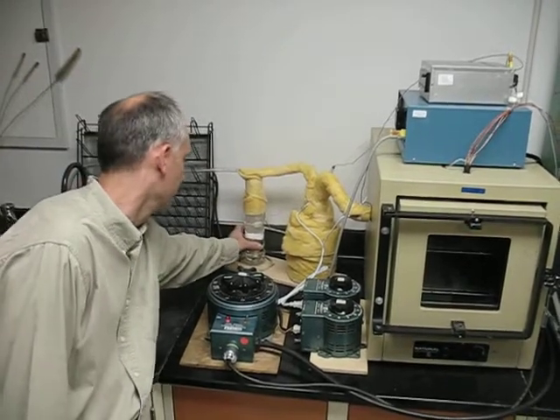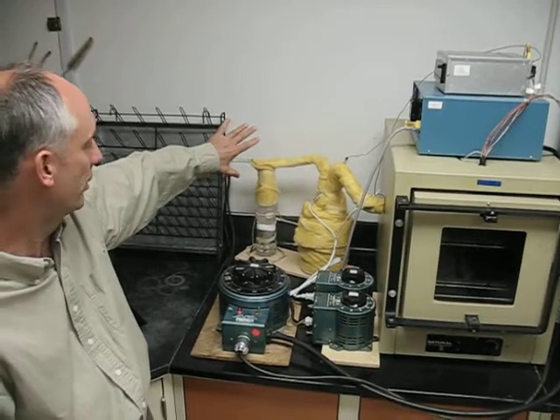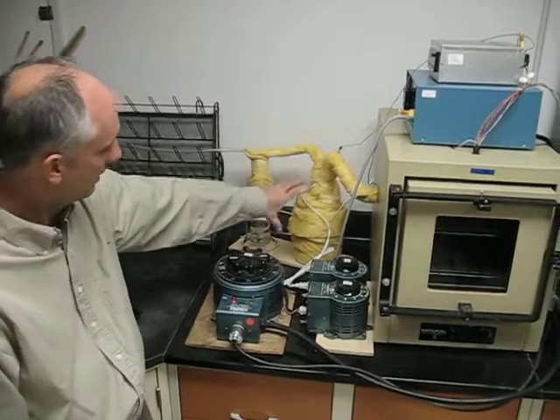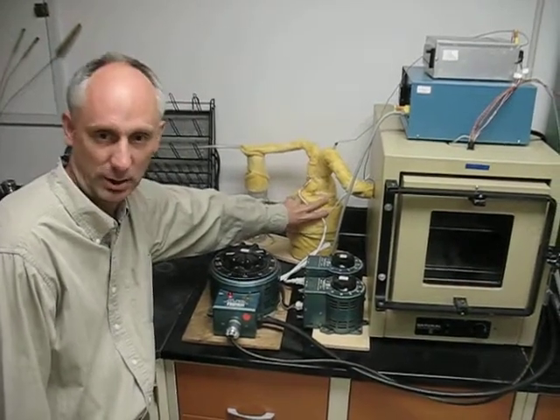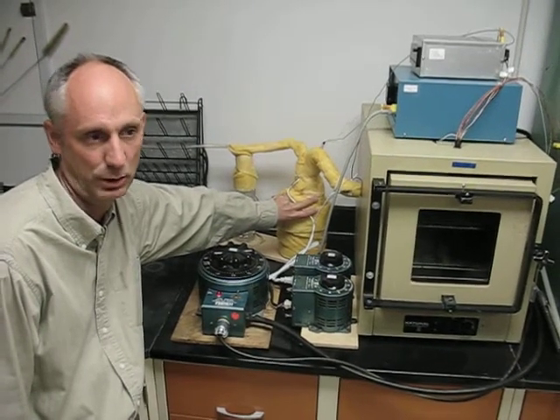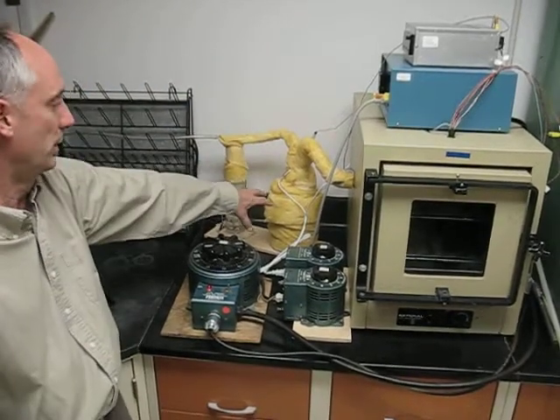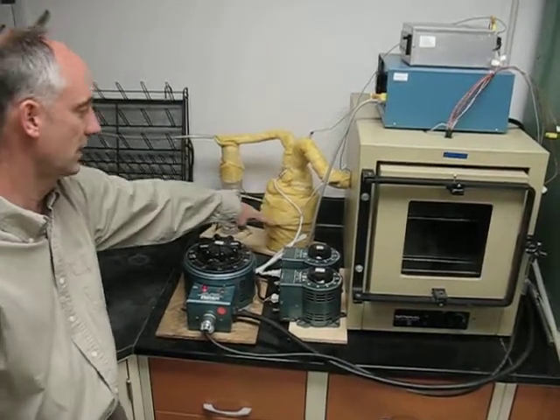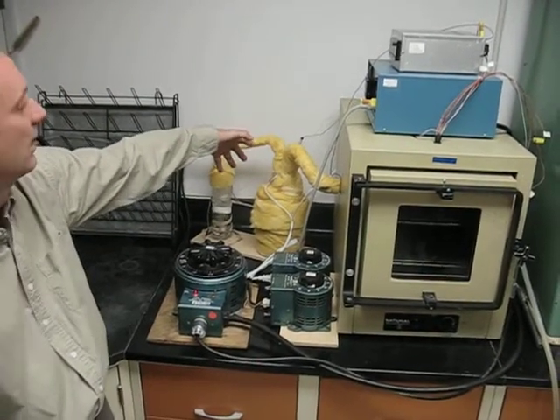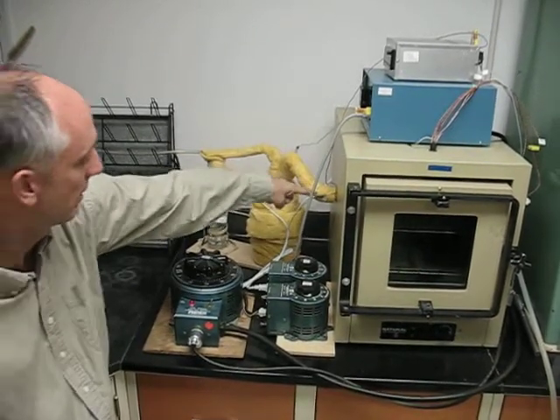This first pre-humidifier is heated to roughly 30 degrees C, and that is just both to make this last a little longer, the final humidifier that is at 37 degrees C, or our desired dew point, and also helps to ensure saturation. We're not putting dry air directly in here. We're putting air in here that's already very humid, and so it further ensures saturation of the air coming out.